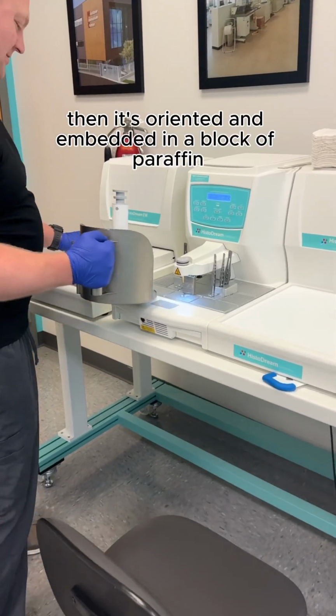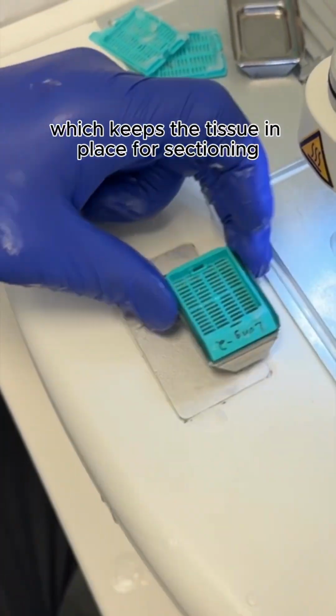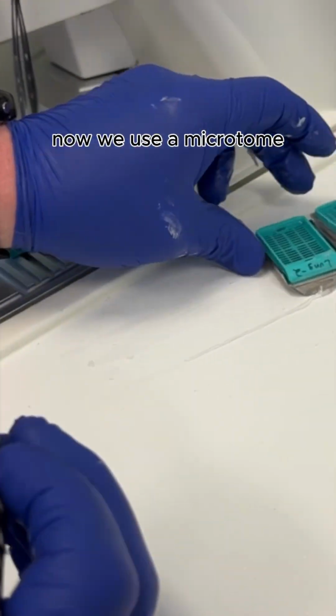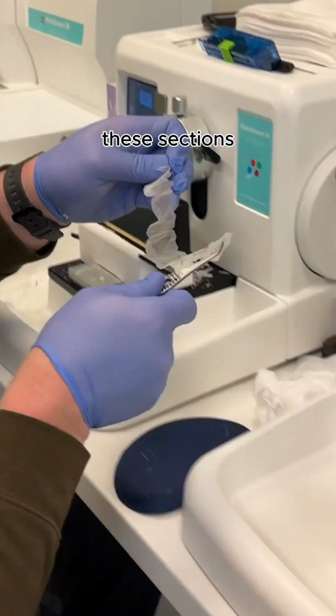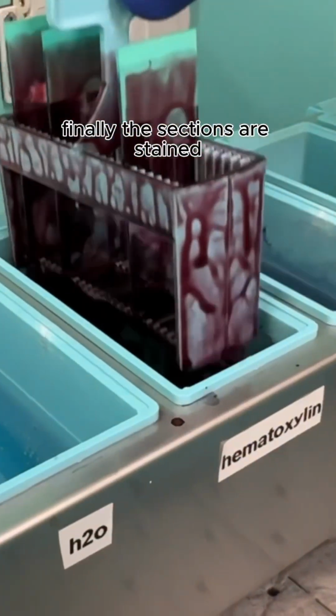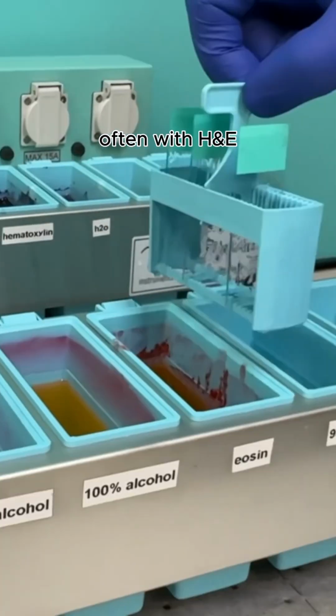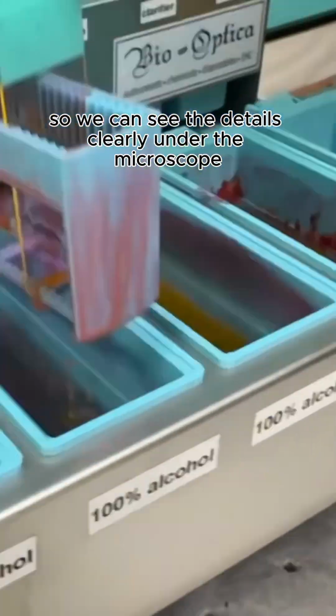Then, it's oriented and embedded in a block of paraffin on an embedding center, which keeps the tissue in place for sectioning. Now, we use a microtome to slice the tissue into super thin sections. These sections can be as thin as the thickness of a human cell. Finally, the sections are stained, often with H&E, to highlight different parts of the tissue so we can see the details clearly under the microscope.